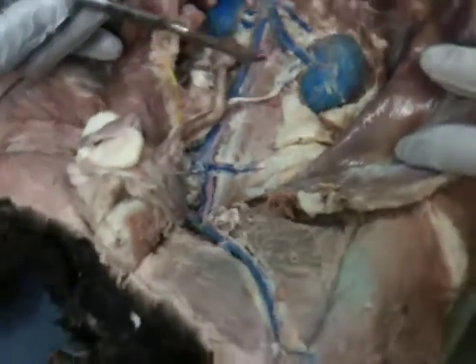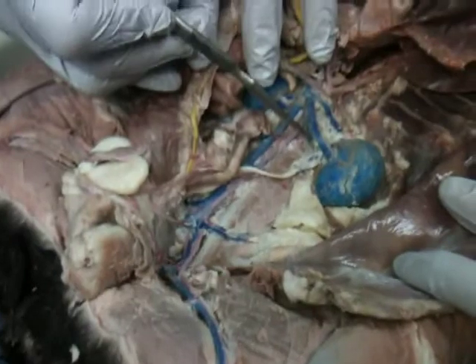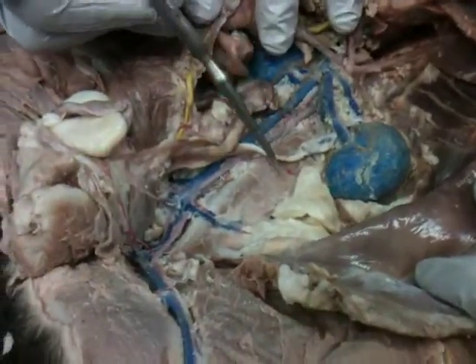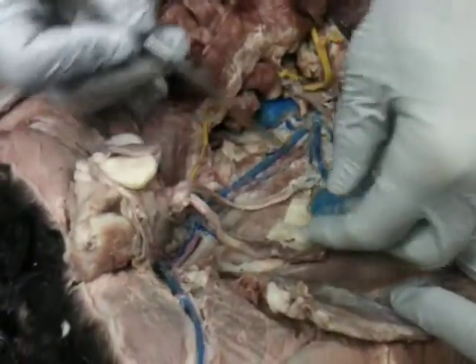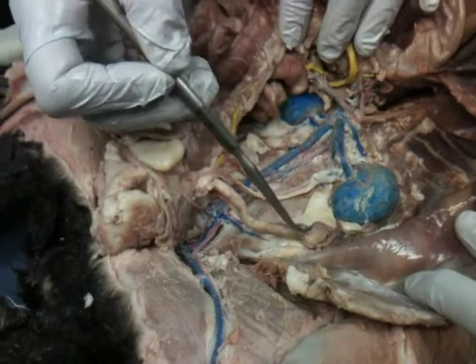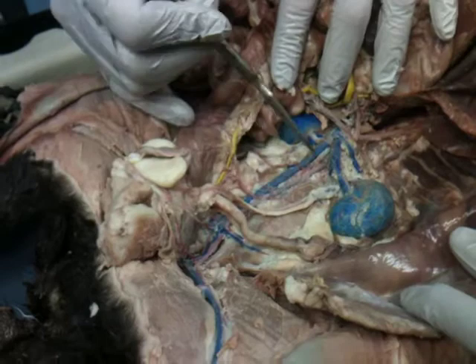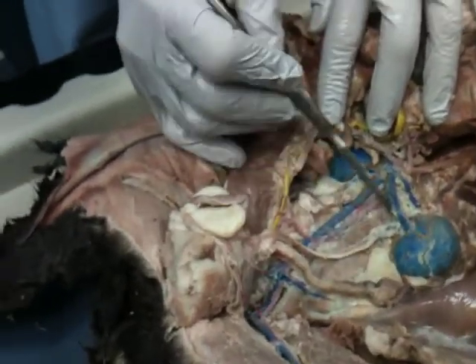Okay. So, one thing that's kind of an interesting oddity that we have about the other veins, this one has been broken off, so I wouldn't test you on that one. But coming from here would go over to this guy. What would we call that vein going over to there? The left gonadal. You will hear it genital also. So this would be our left genital vein or left gonadal vein. In a female, you will see it as ovarian, left ovarian vein.